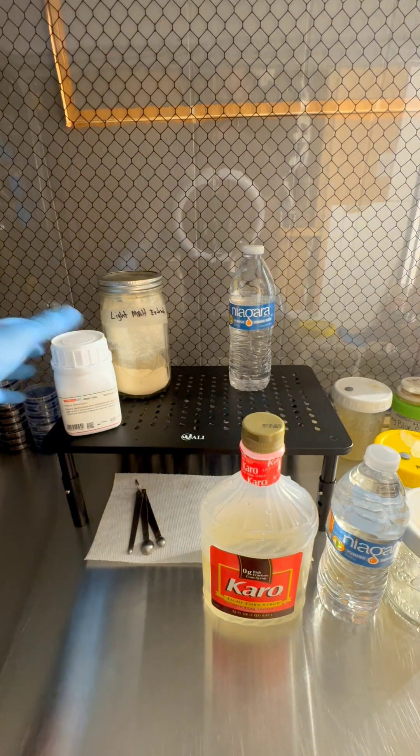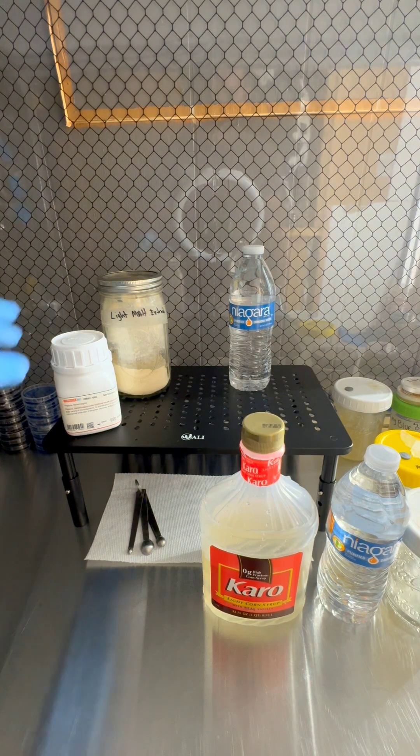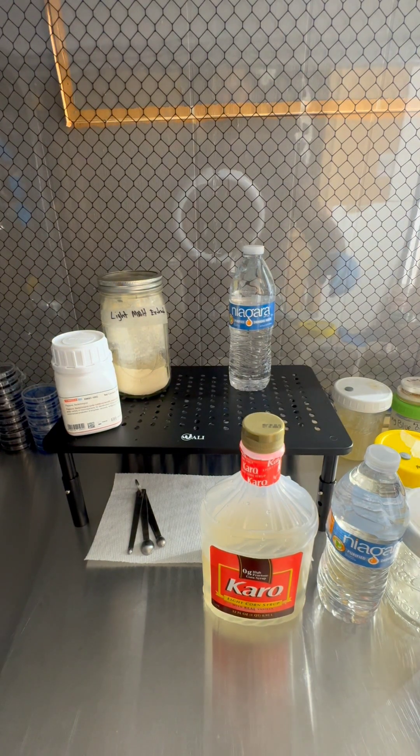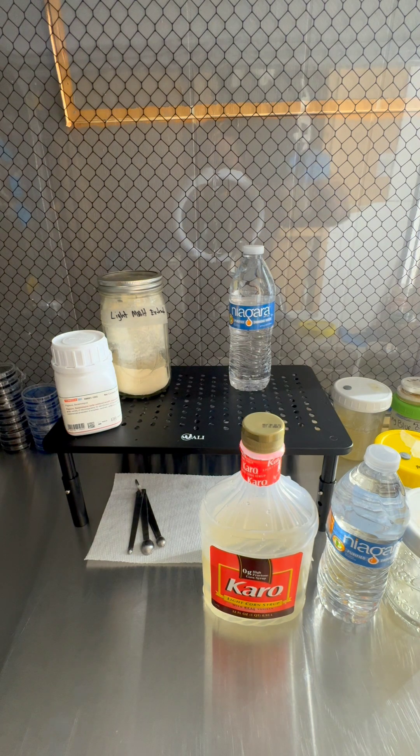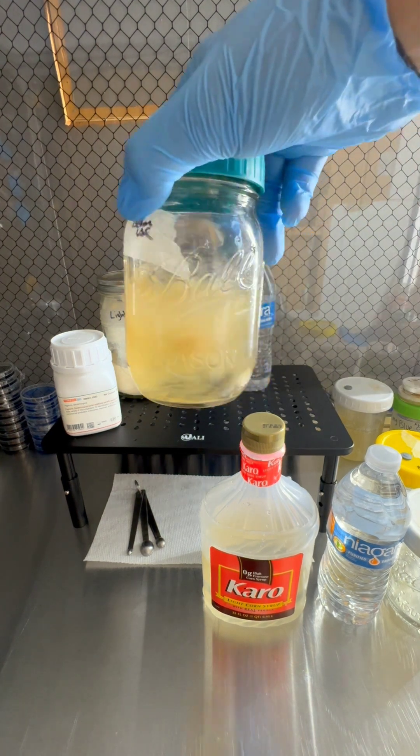So that's going to help give you some robust mycelium like this, very thick.